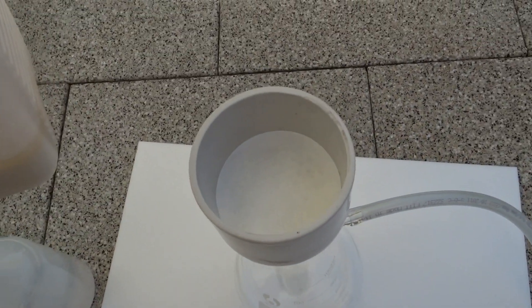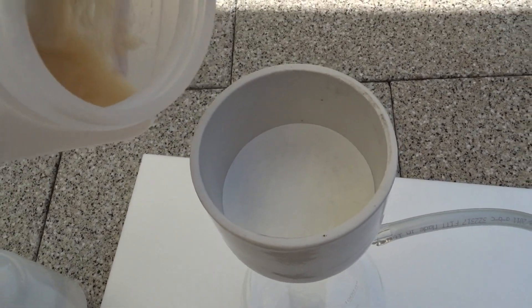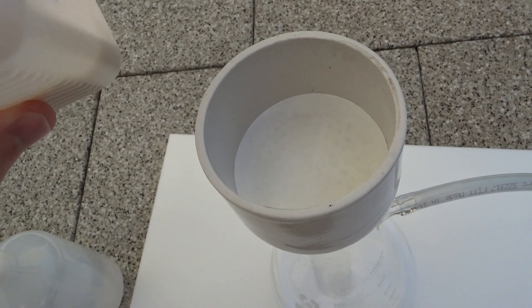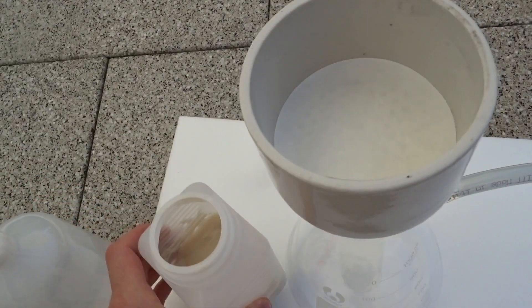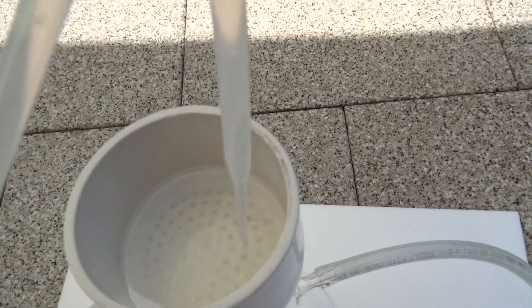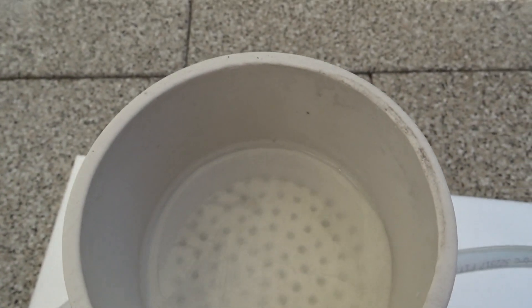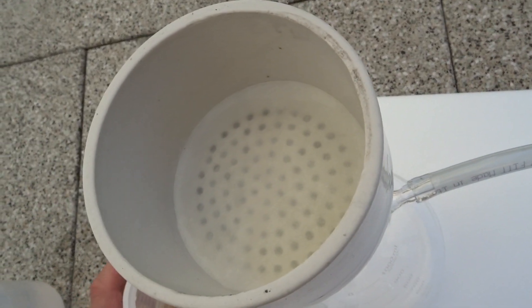I'm absolutely sweating just five minutes out here. I dug myself into the basement. I just forgot to wet the filter paper a little bit first. Pull some nice little vacuum, and it should seal tight now.